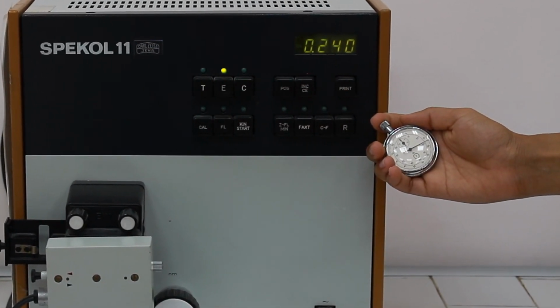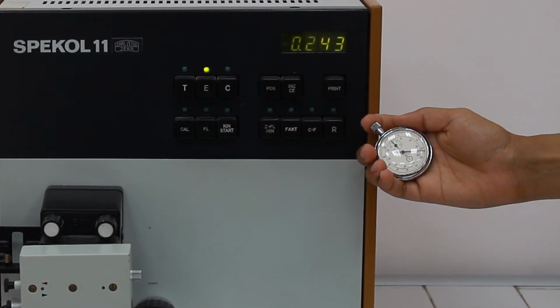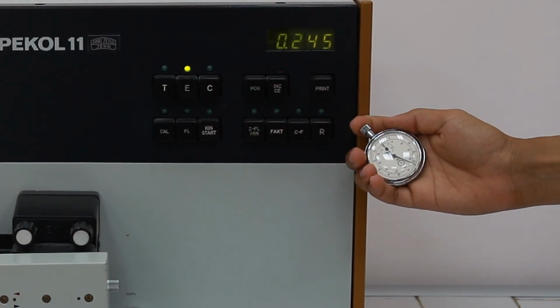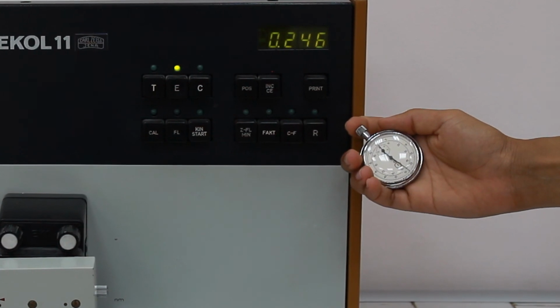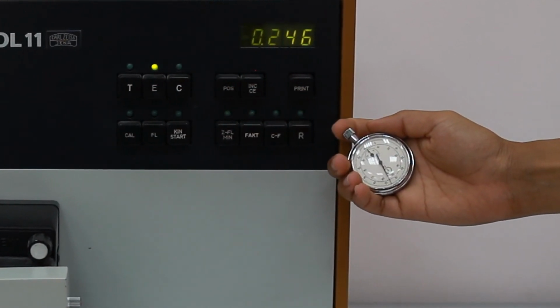We are following the increase of absorbance because the yellow colored product is formed. The higher the increase is, the more active the enzyme is.